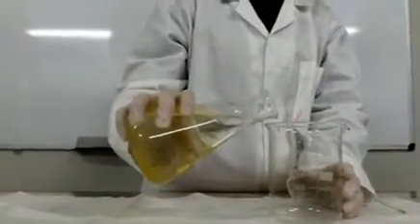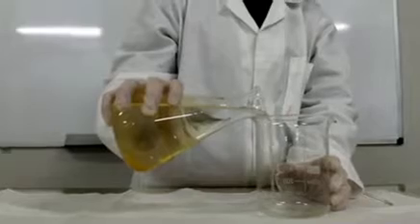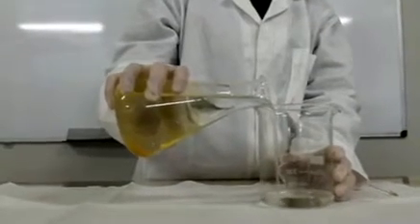The yellow precipitate is allowed to settle at the bottom of the conical flask and most of the potassium nitrate solution is removed by decanting.